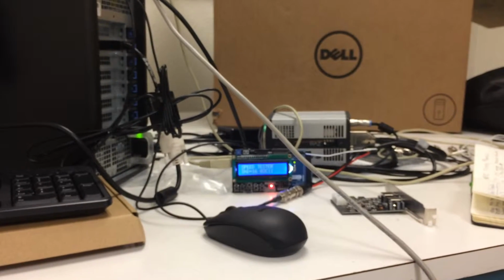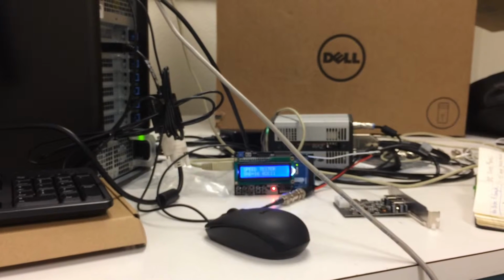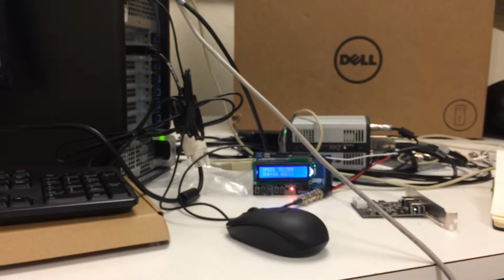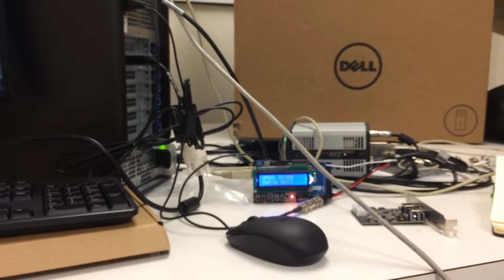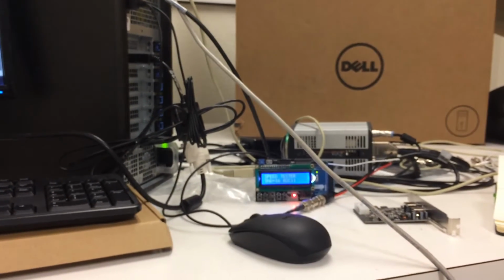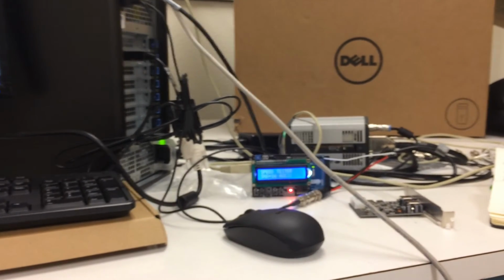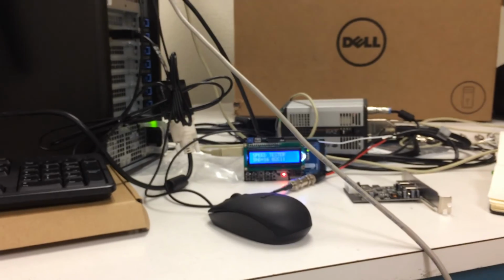So 9.8 millisecond, call it 10 millisecond exposure time produces an 11 millisecond camera open shutter time. I can ascribe that 1 millisecond to error in my system. And then we have a shutter delay of 16 milliseconds, which makes sense to me, again, probably due to just overhead on my system, but nowhere near the 60, 70, 80 milliseconds we see in conventional methods. So this is just a great general example of why streaming is so important.